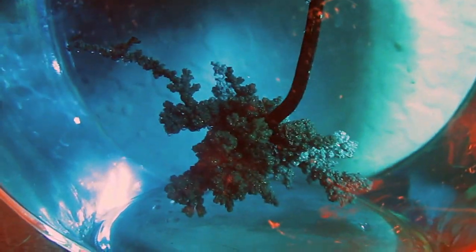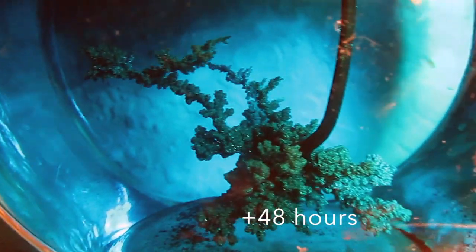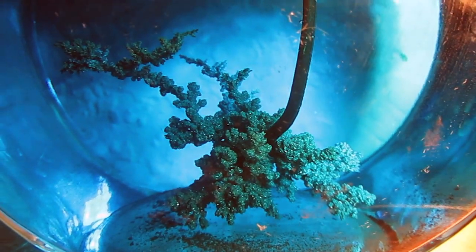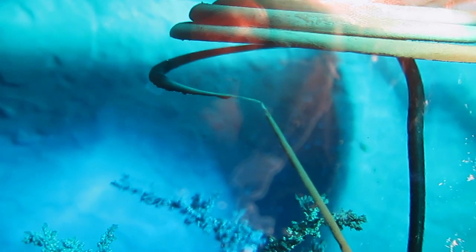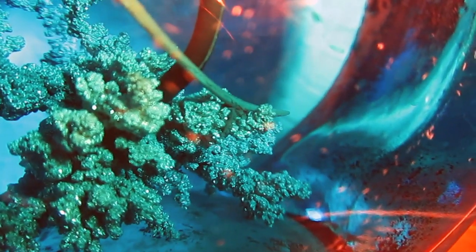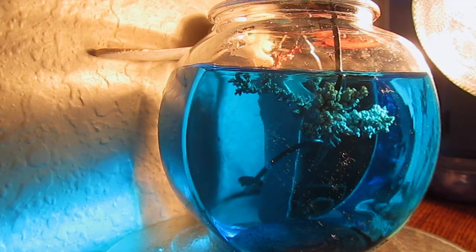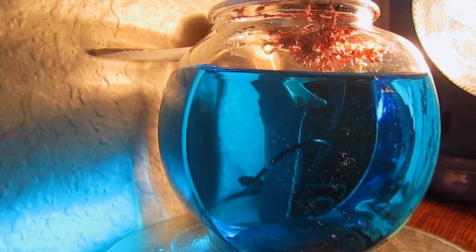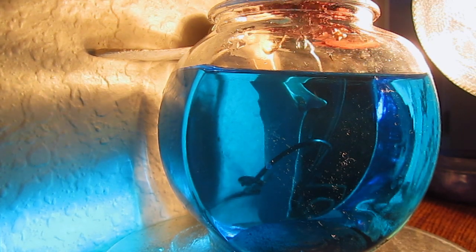So I cleaned out the container and I started again. Now much more current was flowing through the cell and I was getting larger dendrites growing off, until my cell snapped and shorted itself out. Oh well, I was pretty happy with the crystal, so let's take it out and see what it looks like.